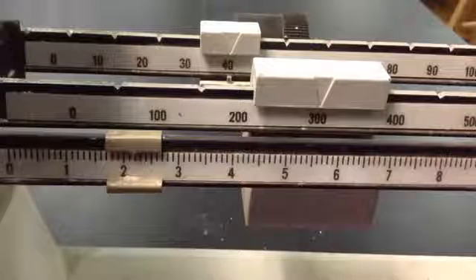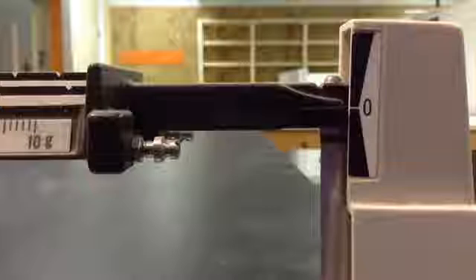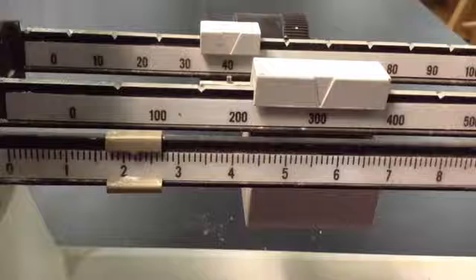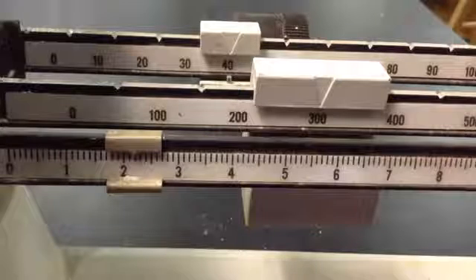my dry ingredient to the bowl sitting on top of the pan that has already been zeroed out. I will gradually add more and more material until my beam hits the zero, and then I'll know I have exactly 342.2 grams of dry material inside my container.